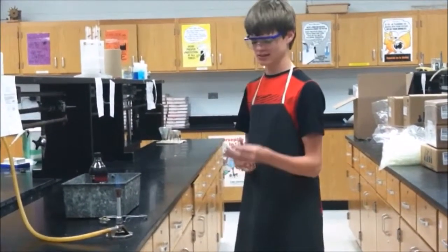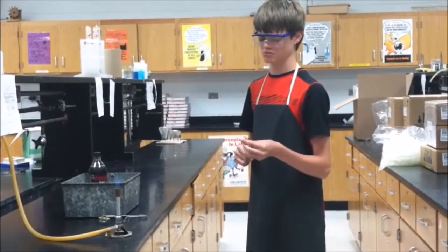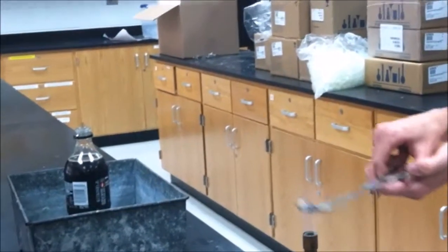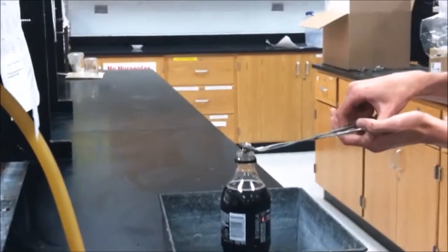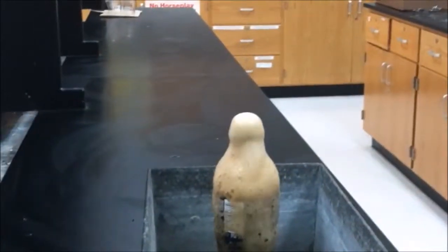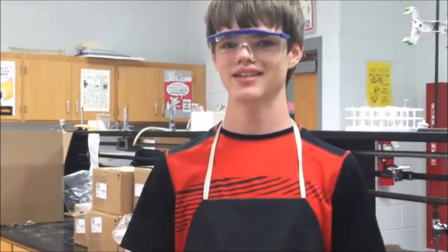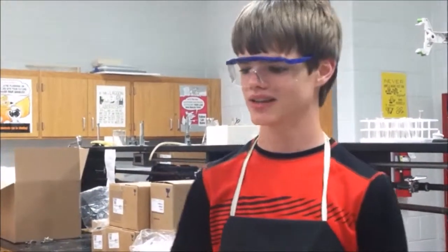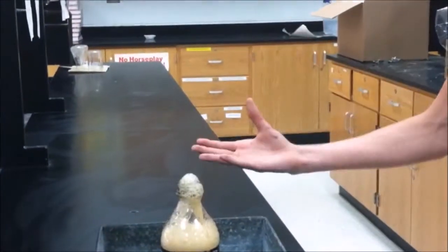Now, we will place the nut into the flame. We will now transition the nut into the soda. As you can see, according to Henry's law, the temperature inside the soda increased, and therefore the solubility of the gas decreased. So all the gas escaped at once, bringing the liquid outside and into the container. And that's Henry's law.